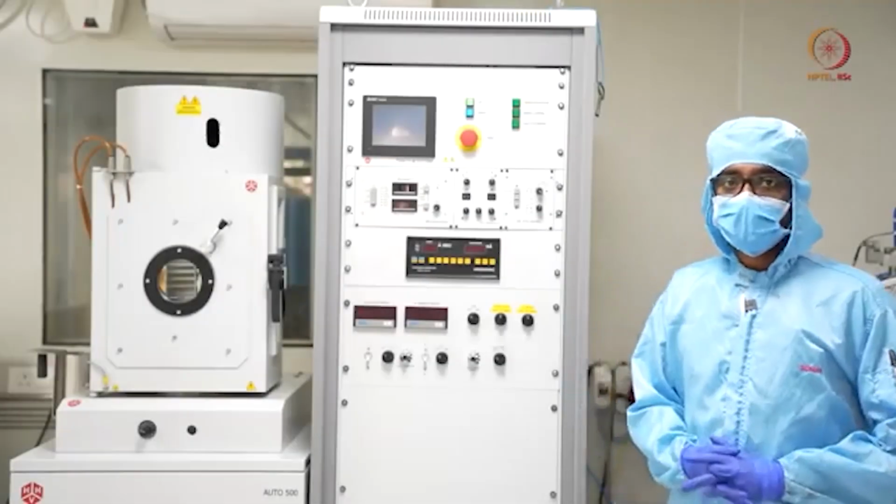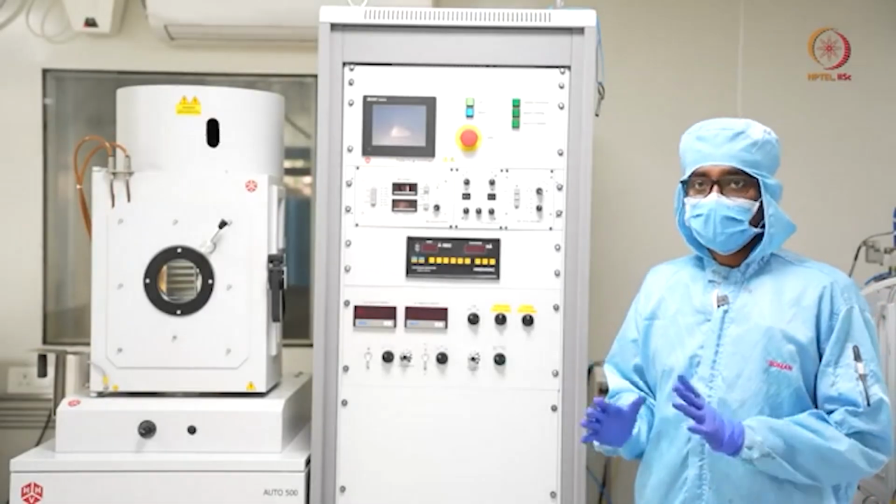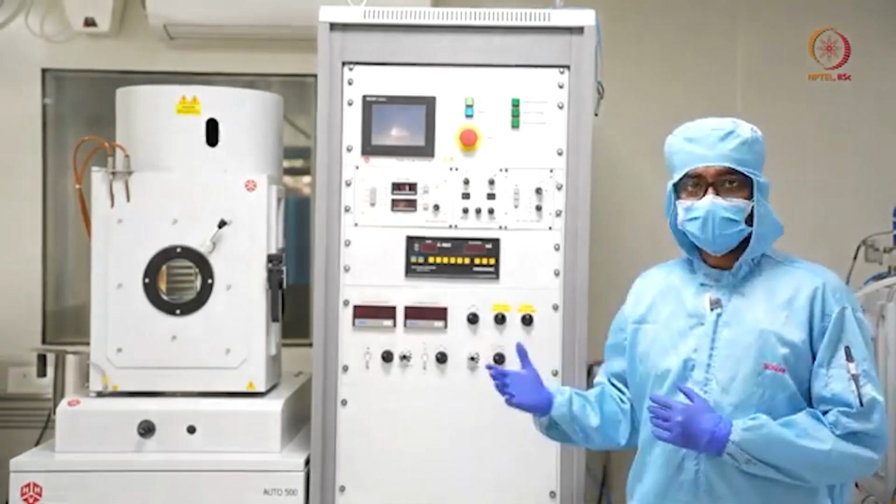Welcome to this lab module. Here today we will be discussing PVD, physical vapor deposition, and we will be demonstrating the process.